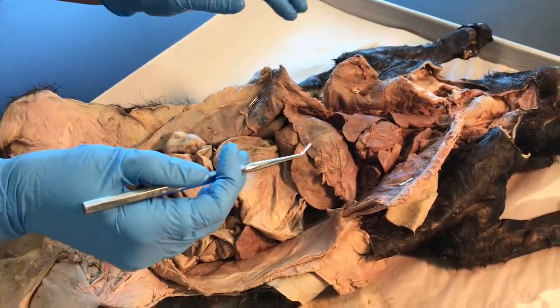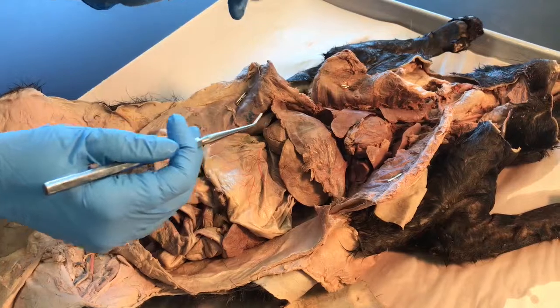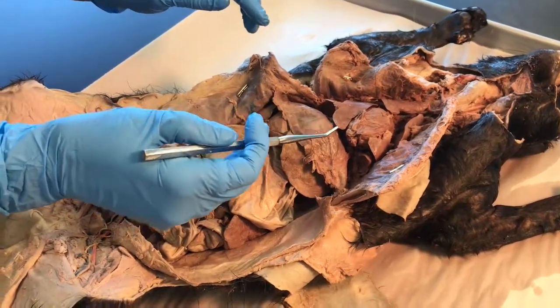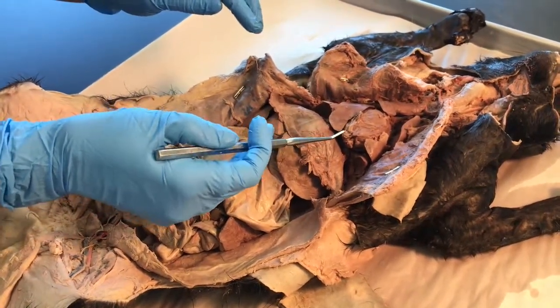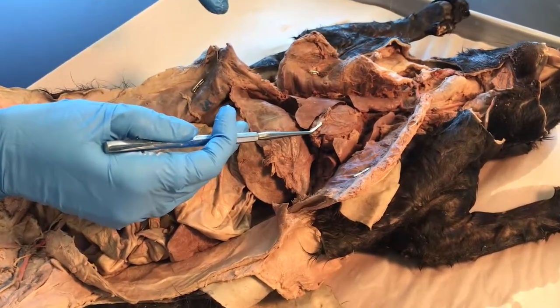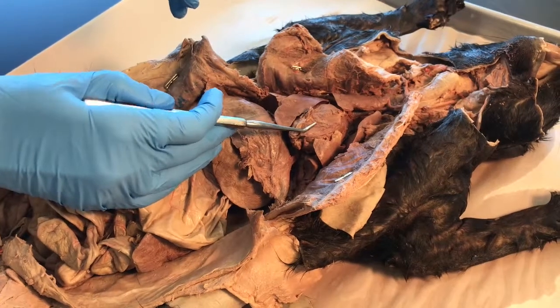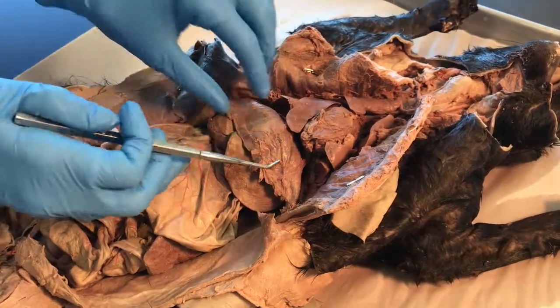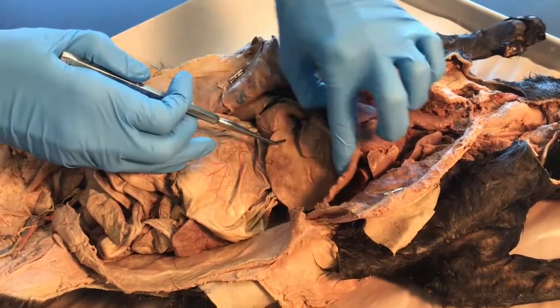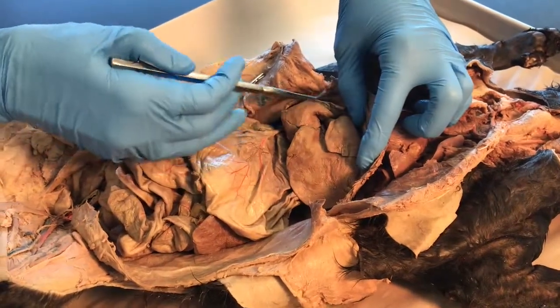Let's review the arteries below the diaphragm. First, let's reorient ourselves with structures so we can figure out where we are. We'll start at the cephalic end of the cat, at the head. Here's the heart, here are the lungs, and here's the diaphragm. Underneath the diaphragm towards the right side is the liver.